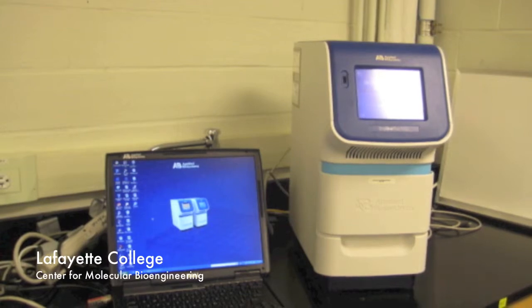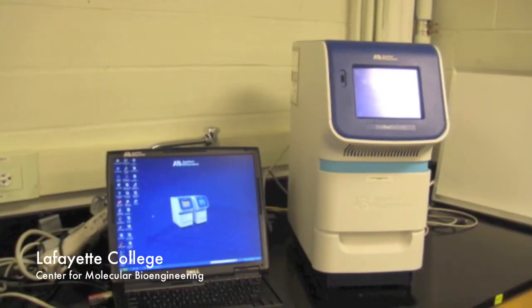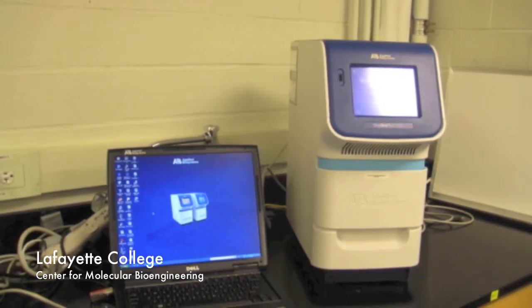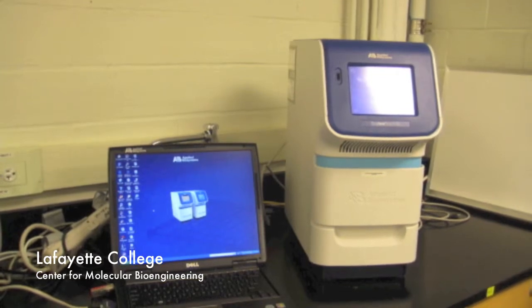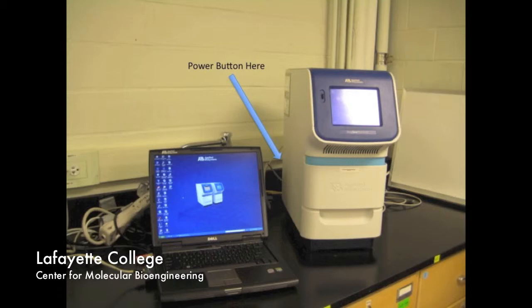In this video, you will learn how to use the Applied Biosystems StepOnePlus Thermocycler software. To set up the PCR reaction, please see the previous videos in this series. Turn on the thermocycler by the power button at the left rear of the instrument.